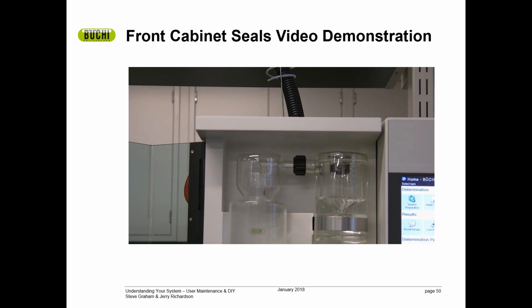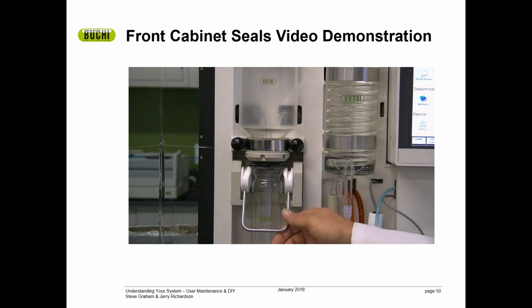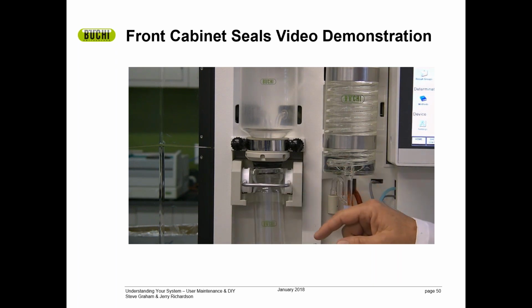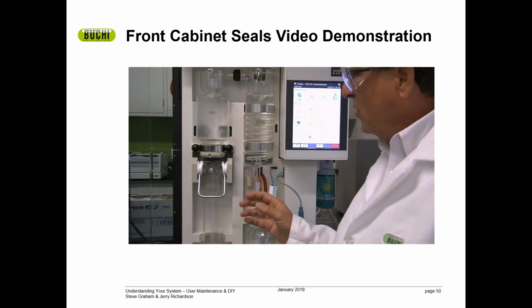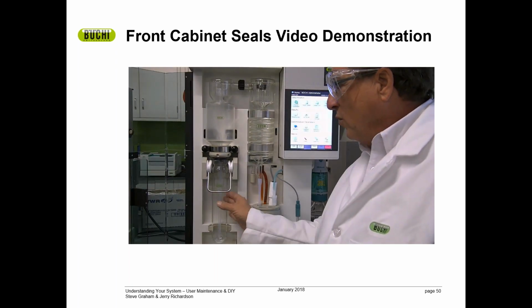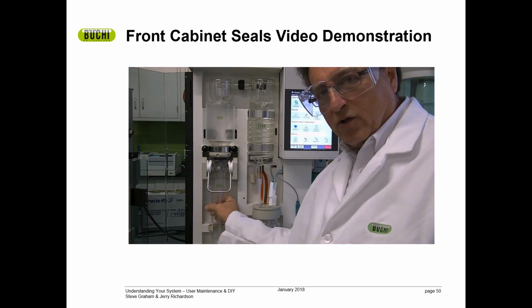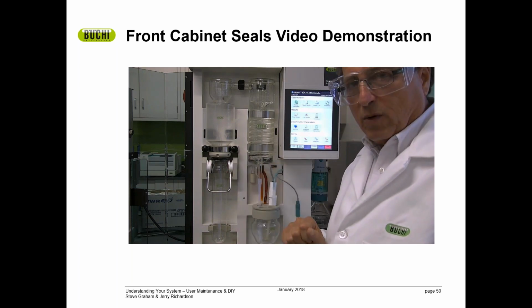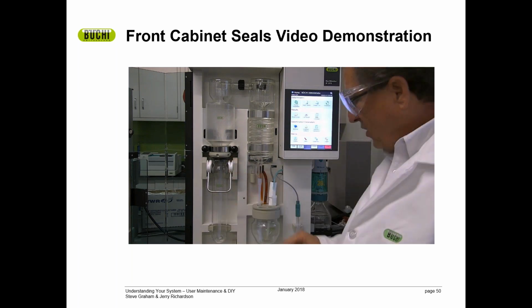The next area is the sample bung and the sample tube. This area, I'll take this off, this rubber bung should be replaced when it's worn. And you ask yourself, how do I know if it's worn? It's a very, very simple test. Do yourself a favor. Every once in a while, with a cold tube, just put the tube on and grab it and try to twist it. If it twists easily, that sample bung needs to be replaced. If it's nice and tight, you have a good seal.